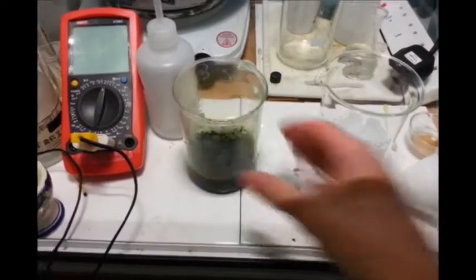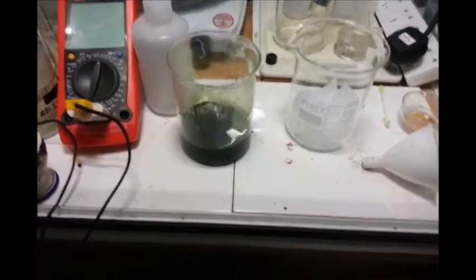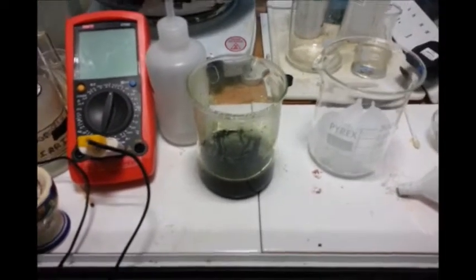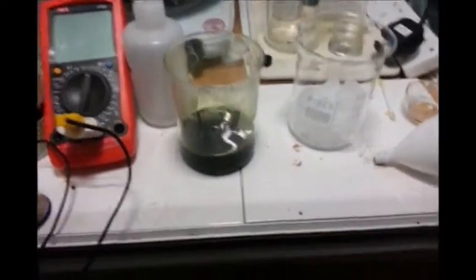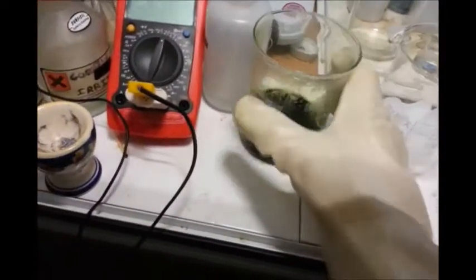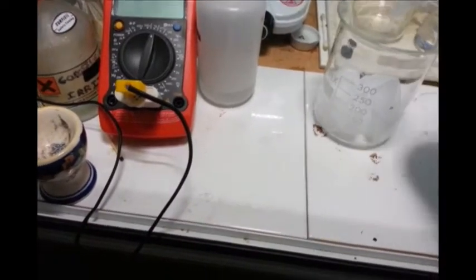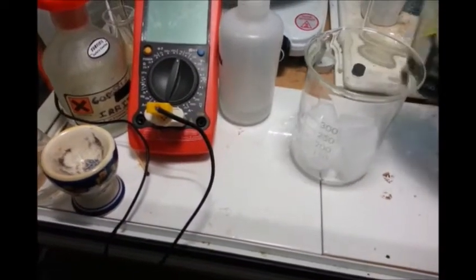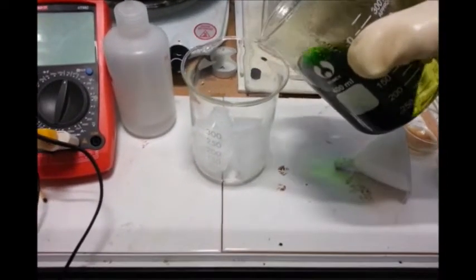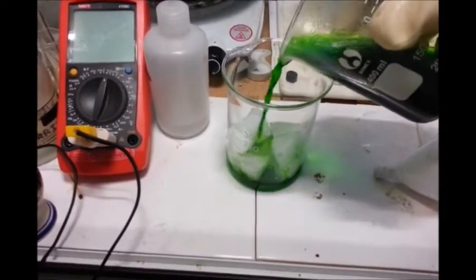I've now let this solution cool down, so what I'm going to do is pour it onto some ice cubes, which will serve to precipitate out the silver — any silver compounds in there — and also any lead, but as they were just copper and gold pins there shouldn't be any lead in there. And it helps dilute it as well, which I'm hoping will make the colour go back to the right colour.